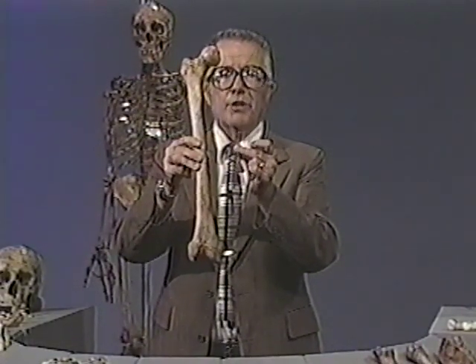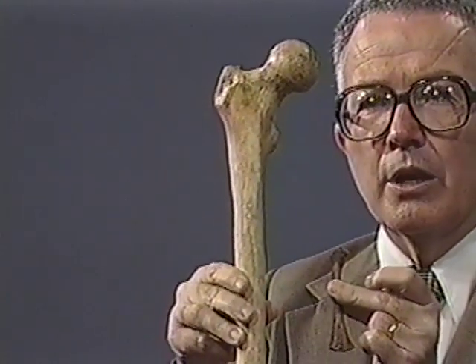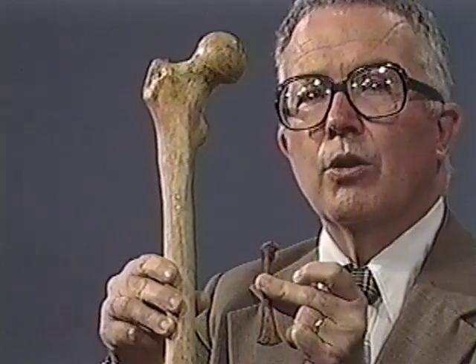These are the same bones. This is a femur of an infant that died at birth. The only difference between these two is a separation of approximately 16 years. Now, how can you grow from this to this in only 16 years? Well, you can do this because you grow at both ends of your bones at the same time. Now, let me go over here and show you some of the growth.